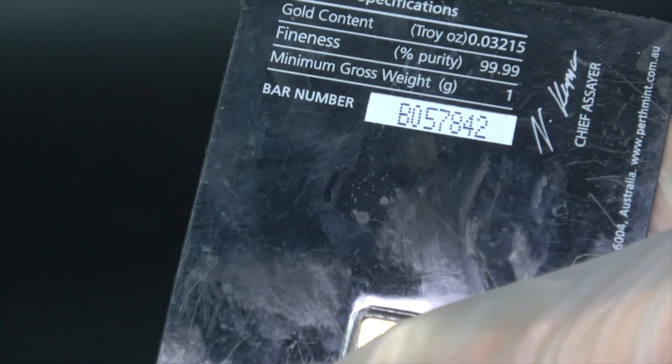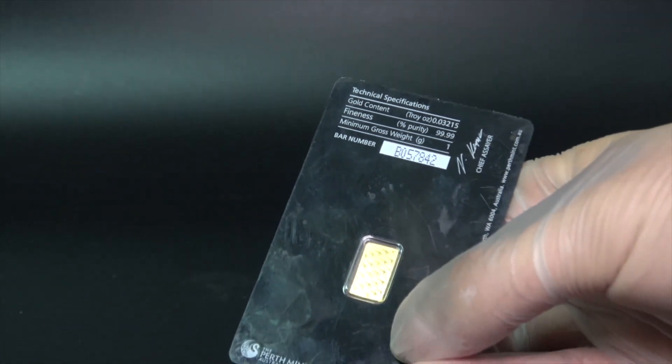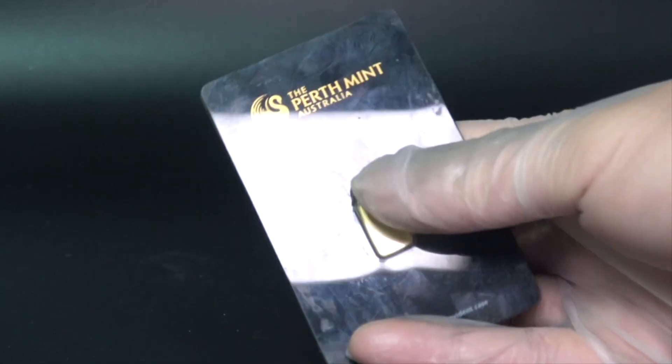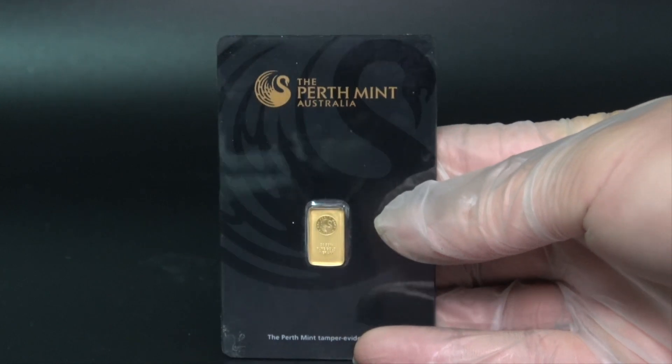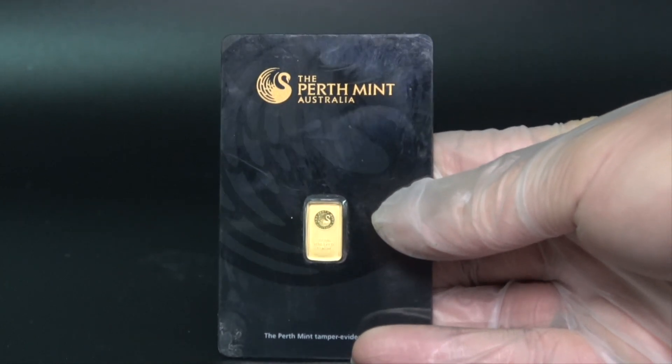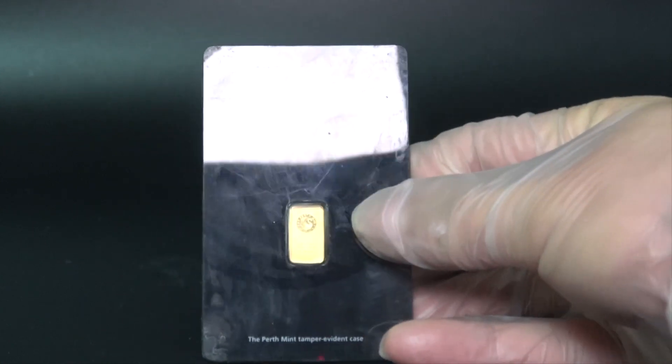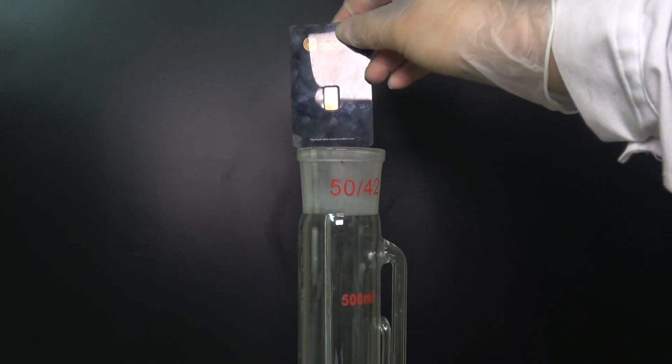Obviously it's got to be taken out of the plastic case before we can mess around with it. I suppose I could use some brutal force, but I'm a man of science and I don't like to use brutal force. Besides, gold is such a soft metal I don't want to damage it during the process. So let's do it the science way.